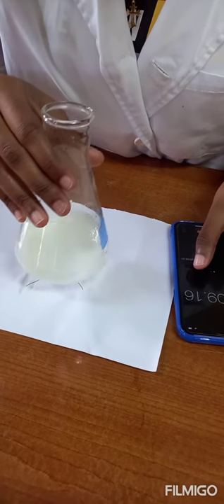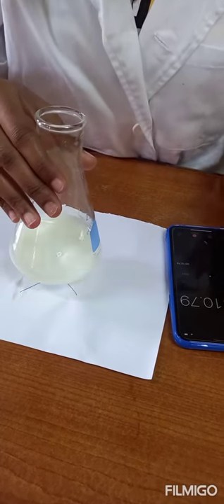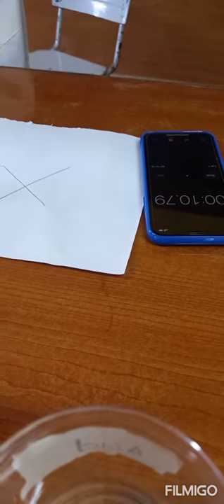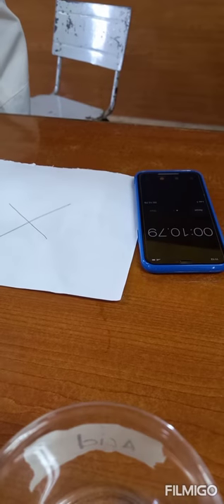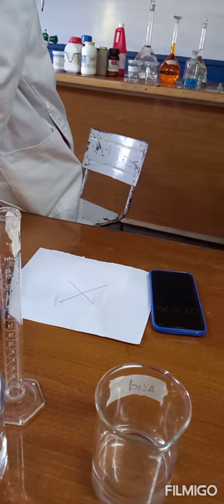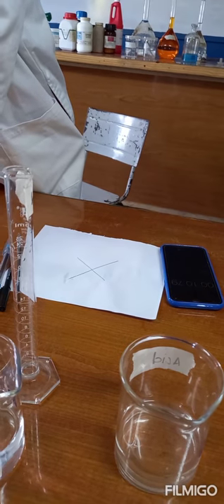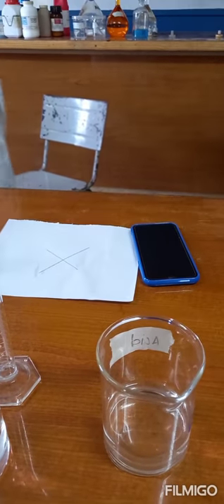It's opaque now — stop and look. This time it took 10.79 seconds. We can see that it takes a longer time as the solution is being diluted, or we can say as the concentration of the thiosulfate decreased it took a longer time. We're going to do three more of these.